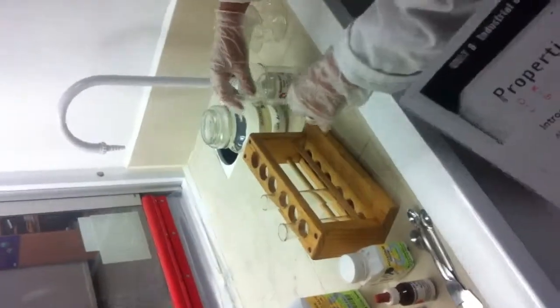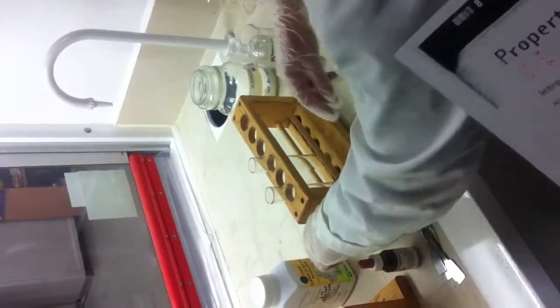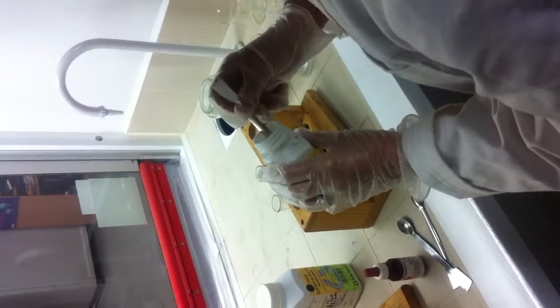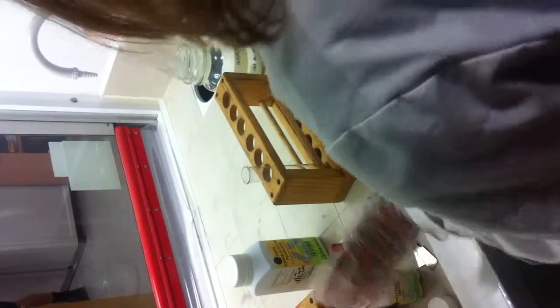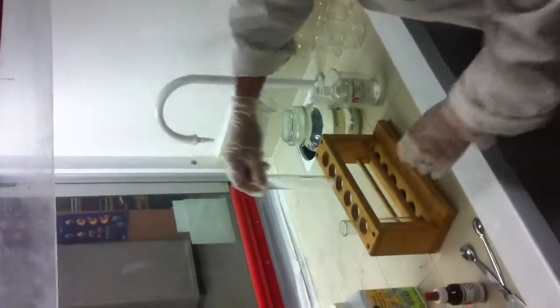Tell me what I'm doing first. Place some potassium iodide on the tip of a spatula, in a test tube, and add two drops of concentrated sulfuric acid. Potassium iodide is a white salt. Stand it in the beaker so it might be easier to see. Two drops of concentrated? Yep.